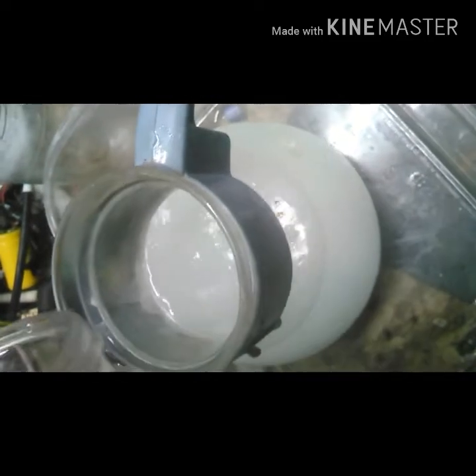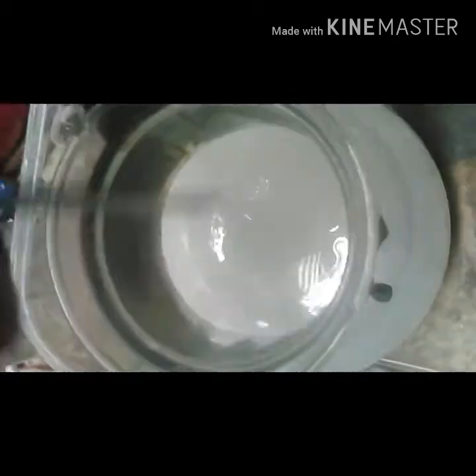One thing you're going to want to do at this point is if you don't have a good fume hood or whatever, you're going to need to do it outside, because this is going to produce ammonia gas. It's not good to do in your garage or anything — you need a fume hood or to be outside.